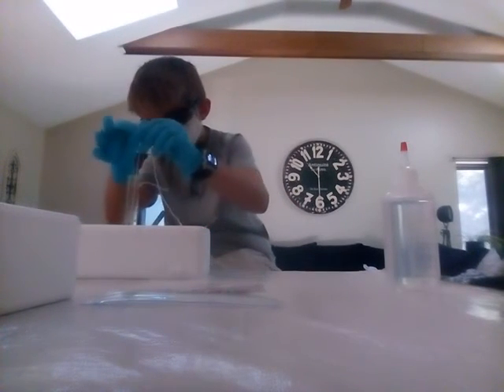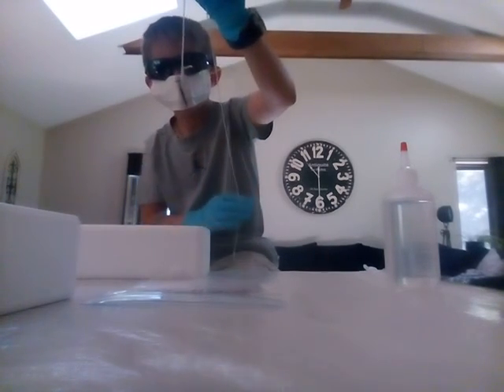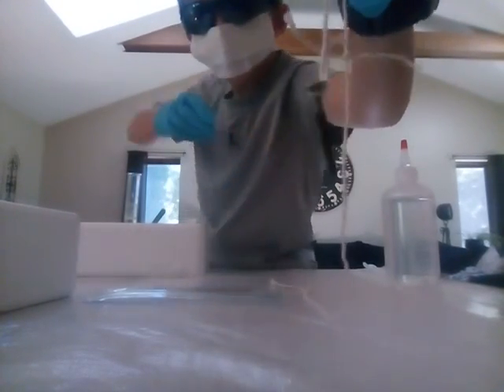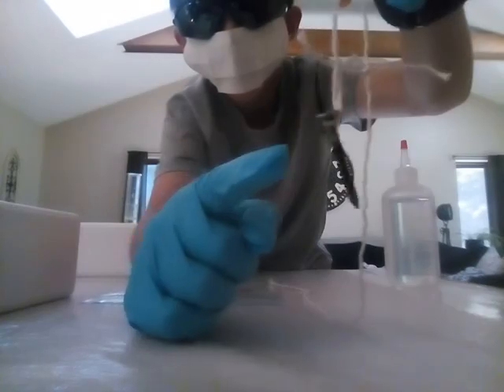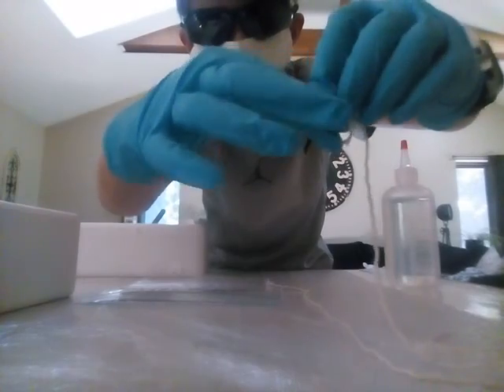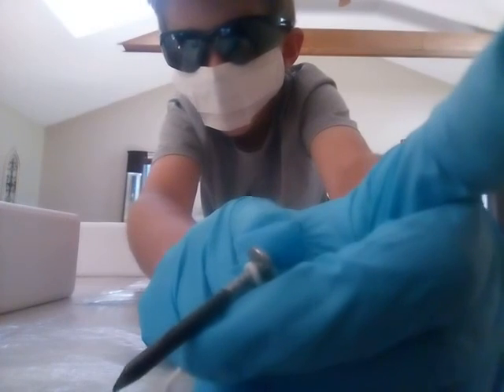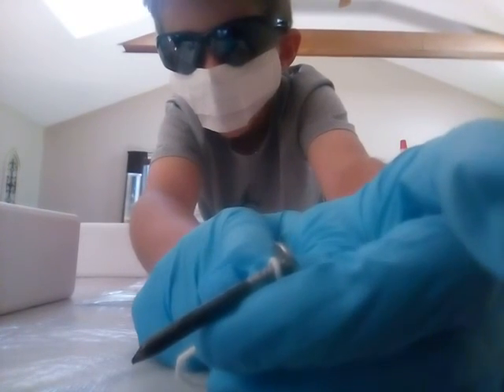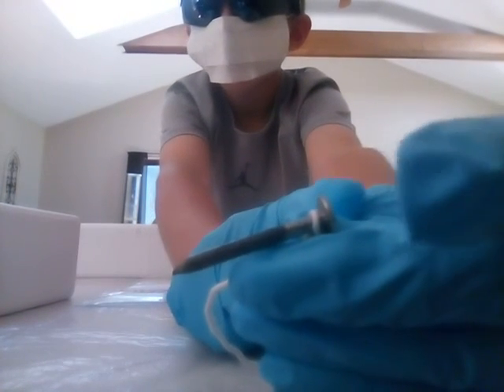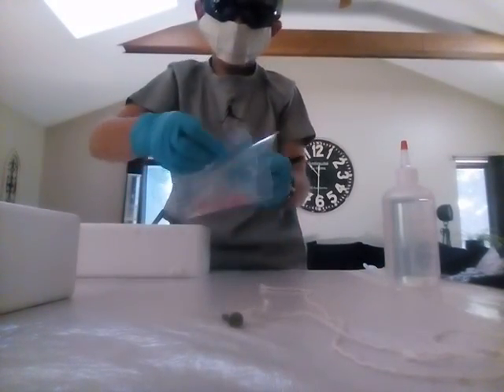Let's check on my nail. There we is! I have coated it with copper. You can see the regular nail right here up at the top — from the top down to there, it's coated with a blackish copper. That's crazy!